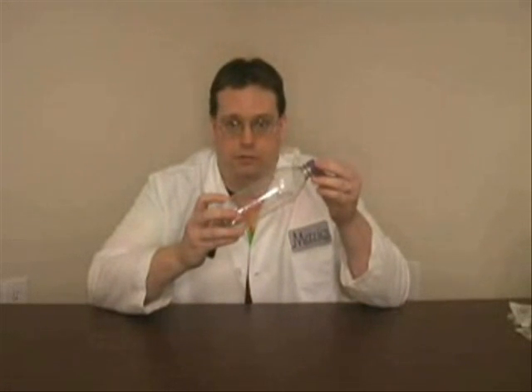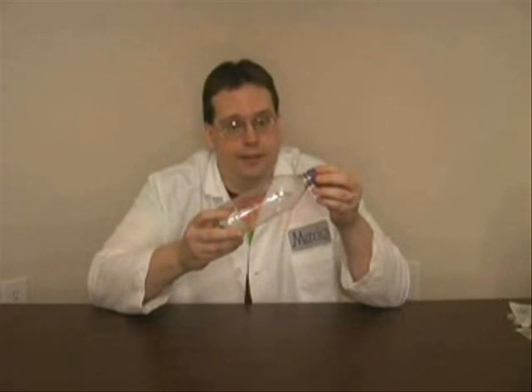Inside of this bottle, I'm going to put four solutions. When I'm finished, the solution should be orange. But when I shake this bottle once, it should turn red. And when I shake it again, it's going to turn green. Eventually, it's going to go back to orange, and we can do the whole reaction again.